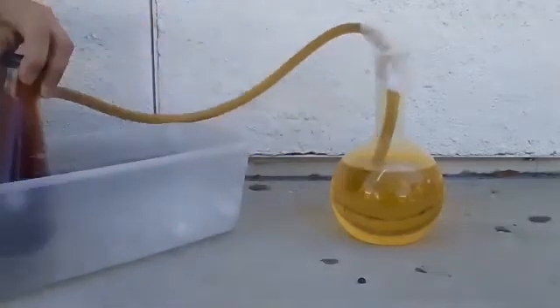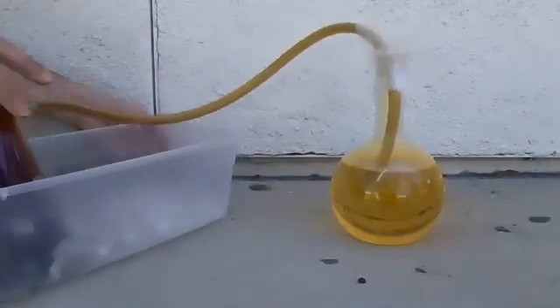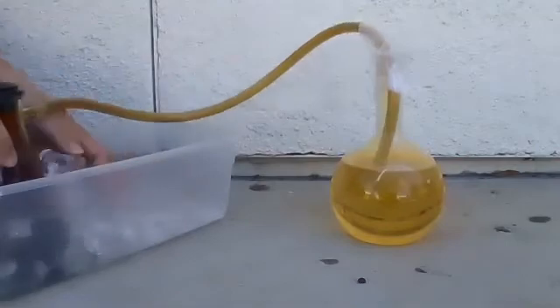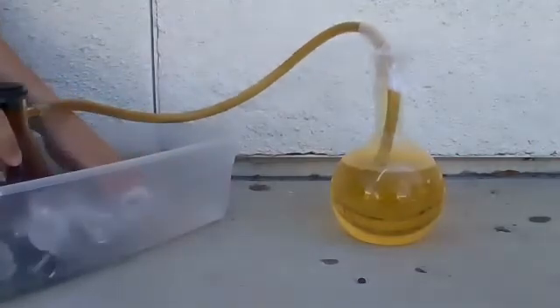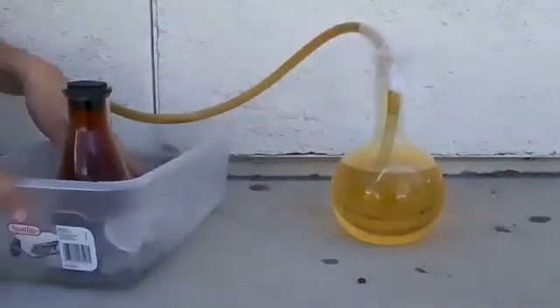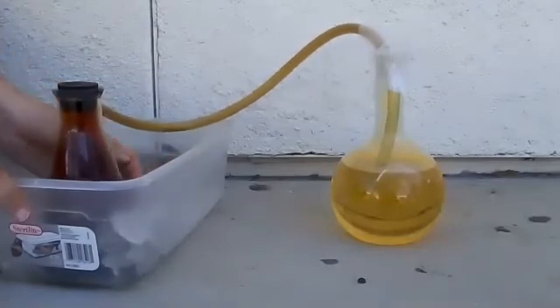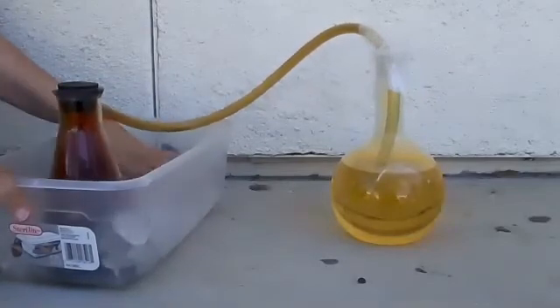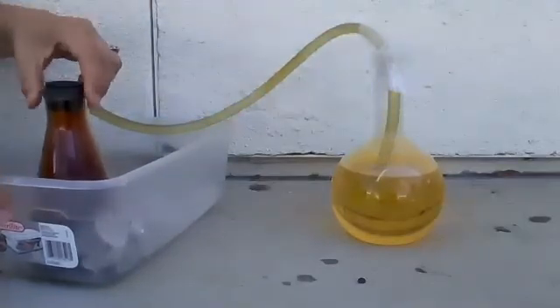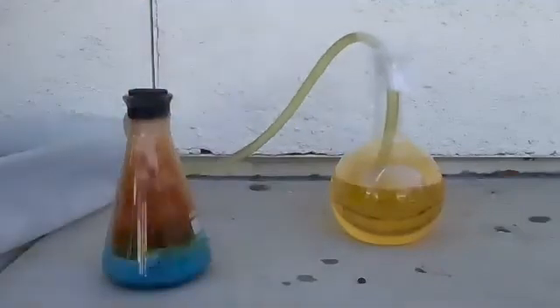I'm going to try to pull it off a little bit and then we'll start to see the liquid coming up. You see it? It's already rising. All I'm doing is just cooling off the bottle. Okay, come on — there we go!